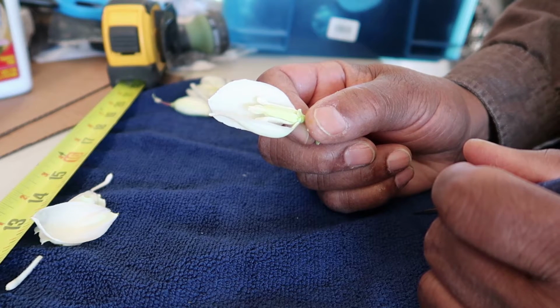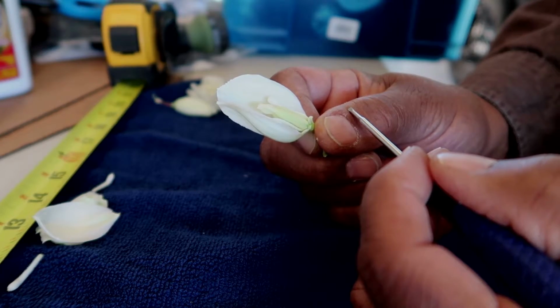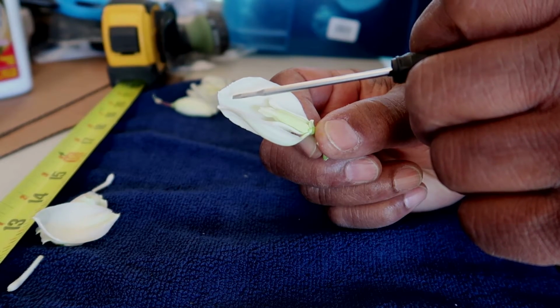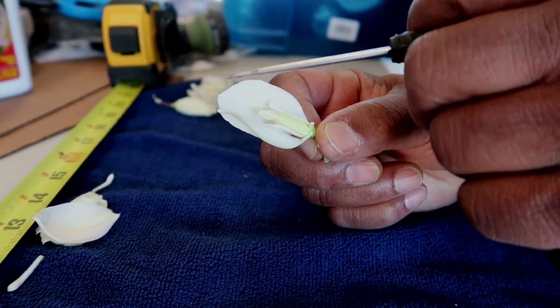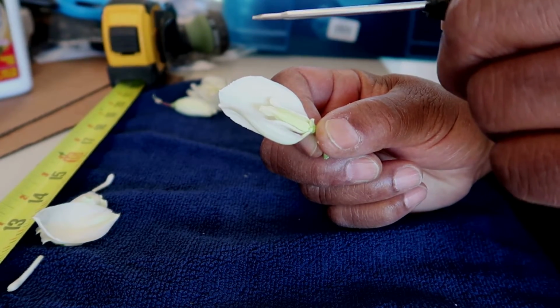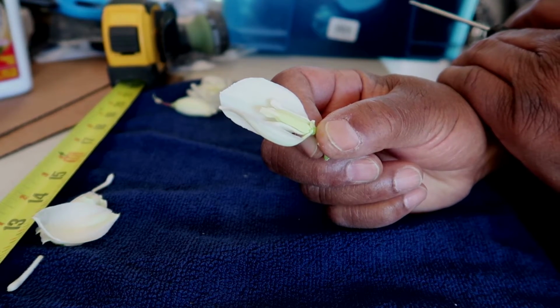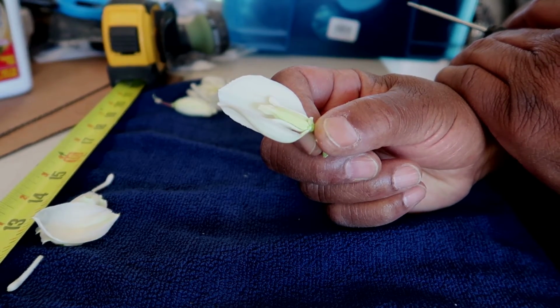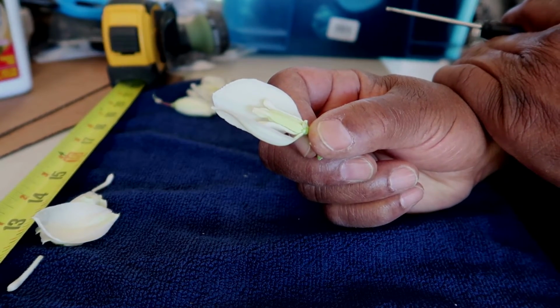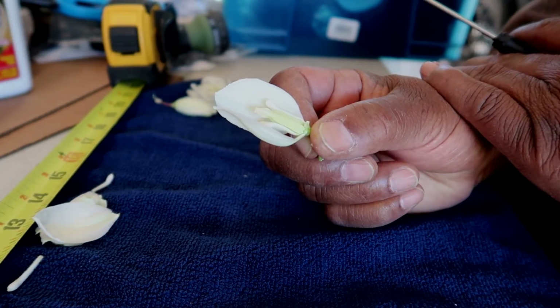What happens in the Joshua tree flower? The Tegeticula moth enters the top of the flower when it's open, and for the typical Joshua tree, this opens slightly at nighttime. For the eastern type Joshua tree, the flower is slightly opened during the daytime. Either way, let's stick with the typical Joshua tree.